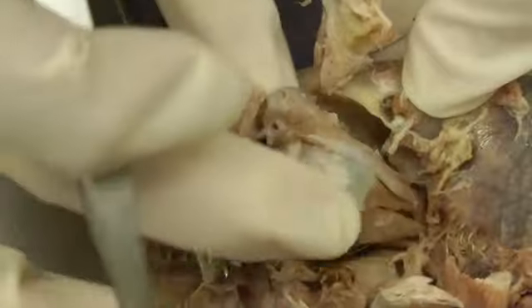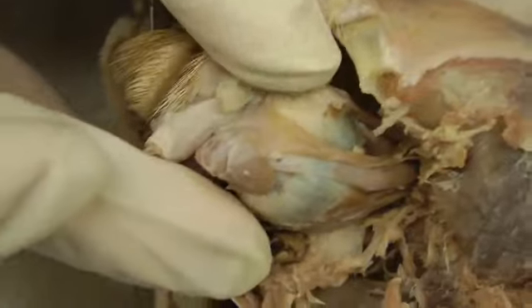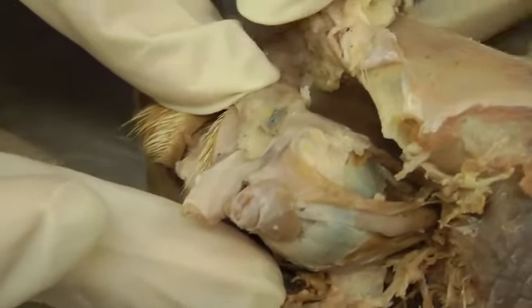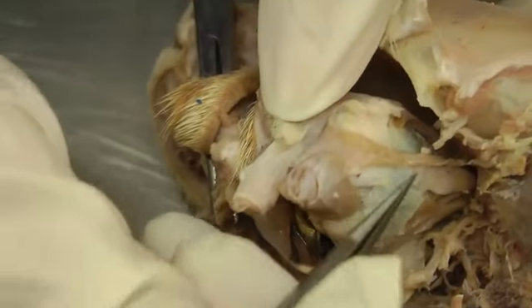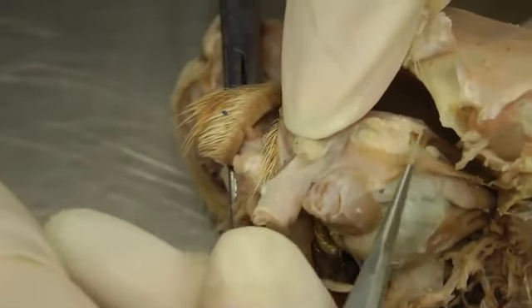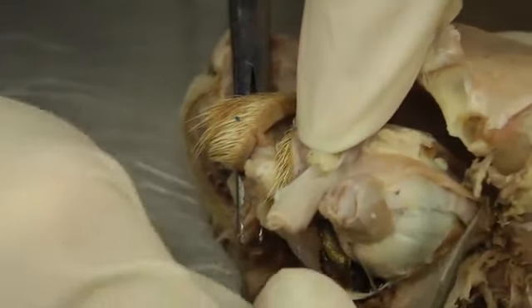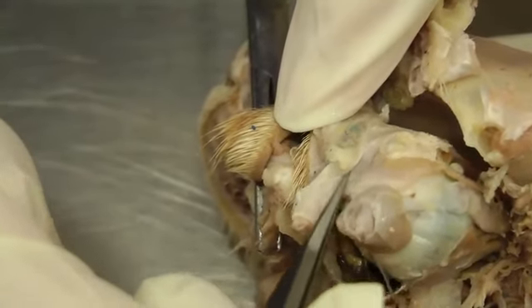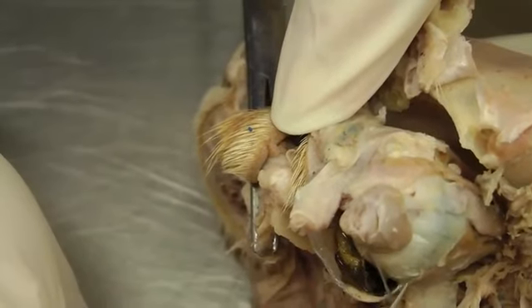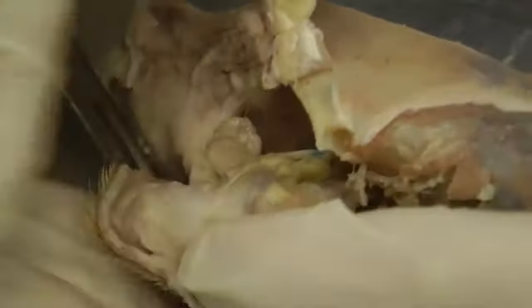And we'll move up to the dorsal aspect again and roll the eyeball out a little bit. So you're going to detach it here and then roll it laterally. So then we have, sitting on top of the dorsal rectus here, your levator palpebrae superioris. And I just ripped it. That's too bad. But it's right here, and it sits right on top of that dorsal rectus and goes up a little further because it's going to the eyelid. So levator palpebrae superioris.